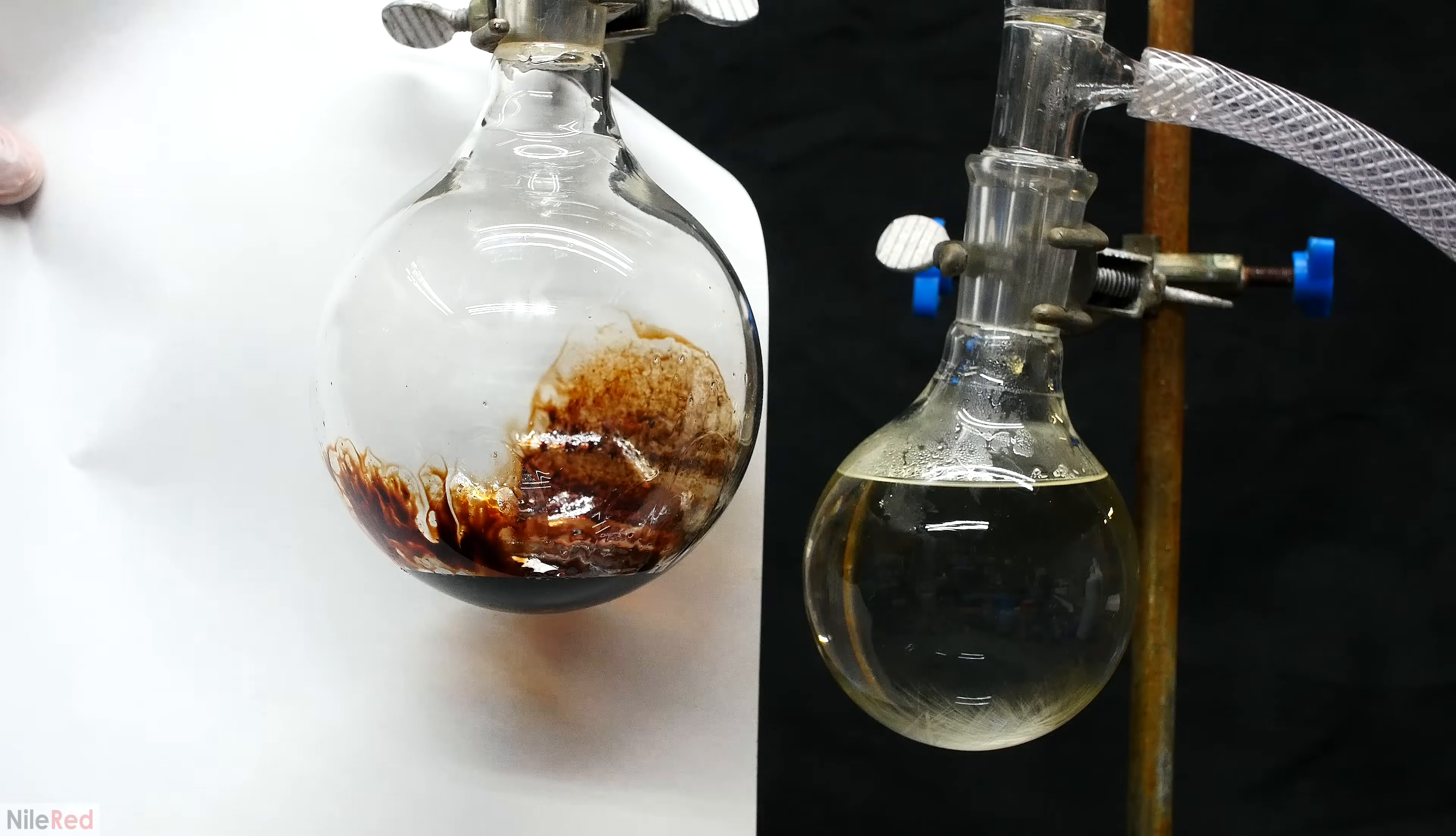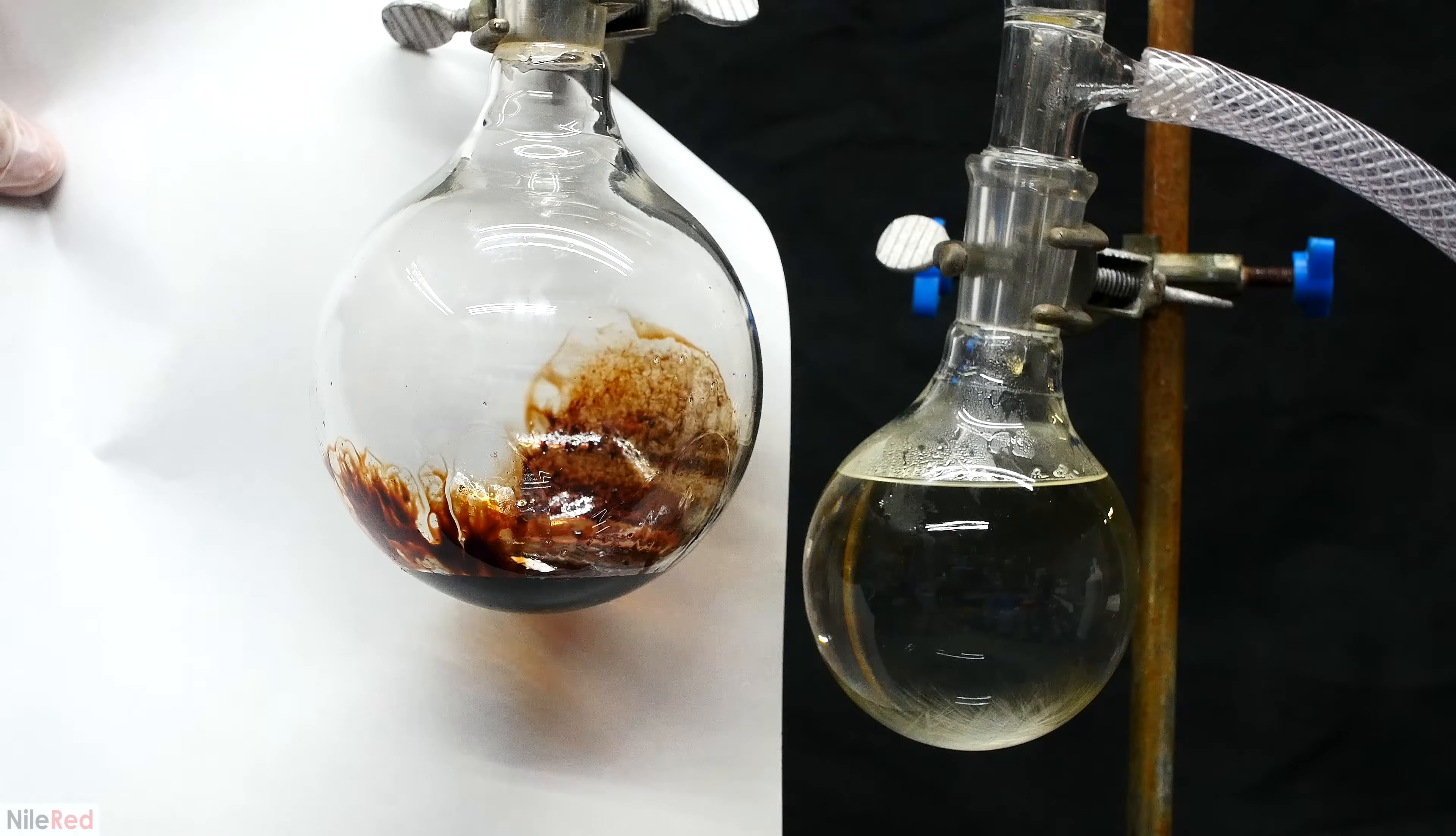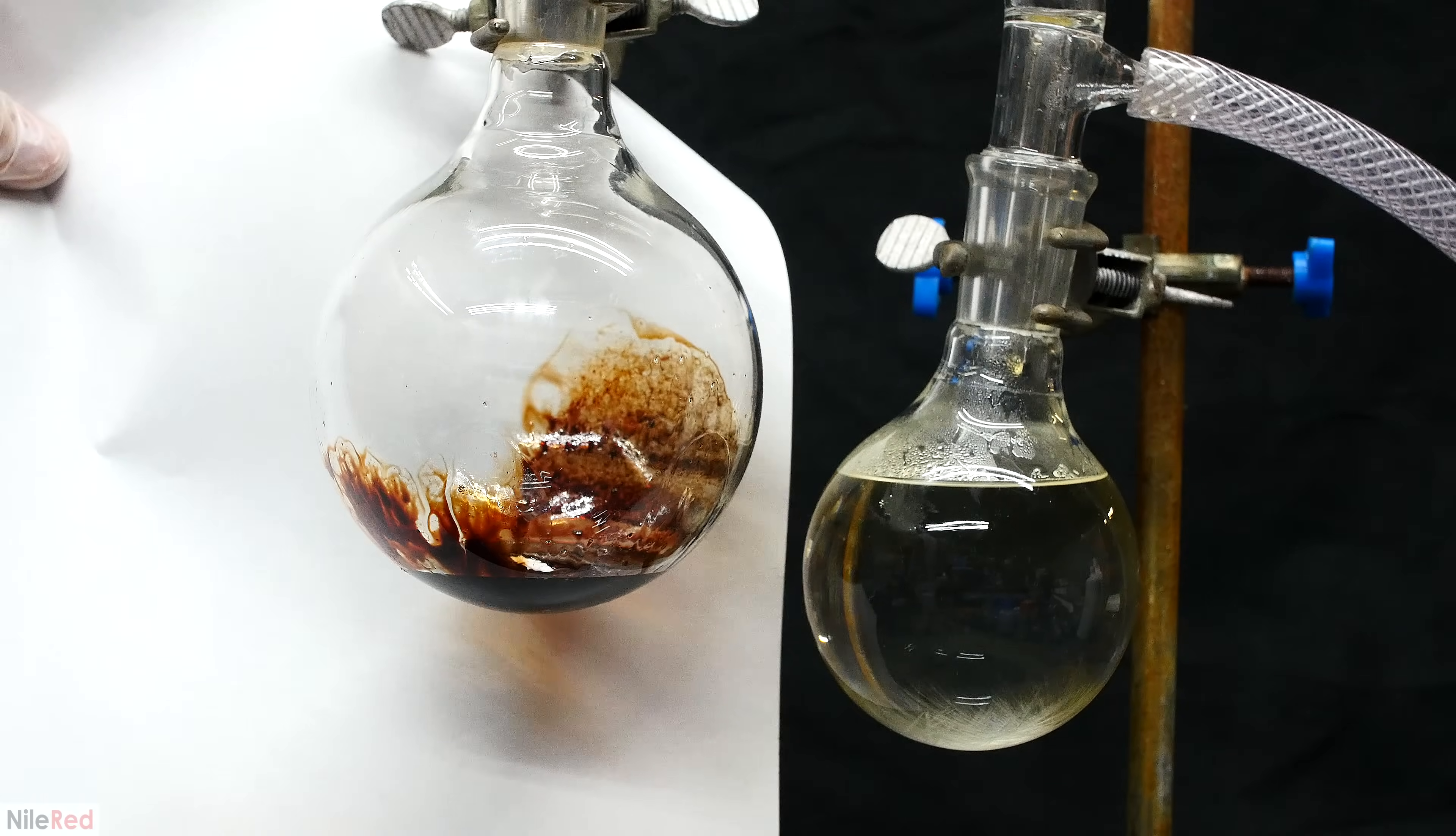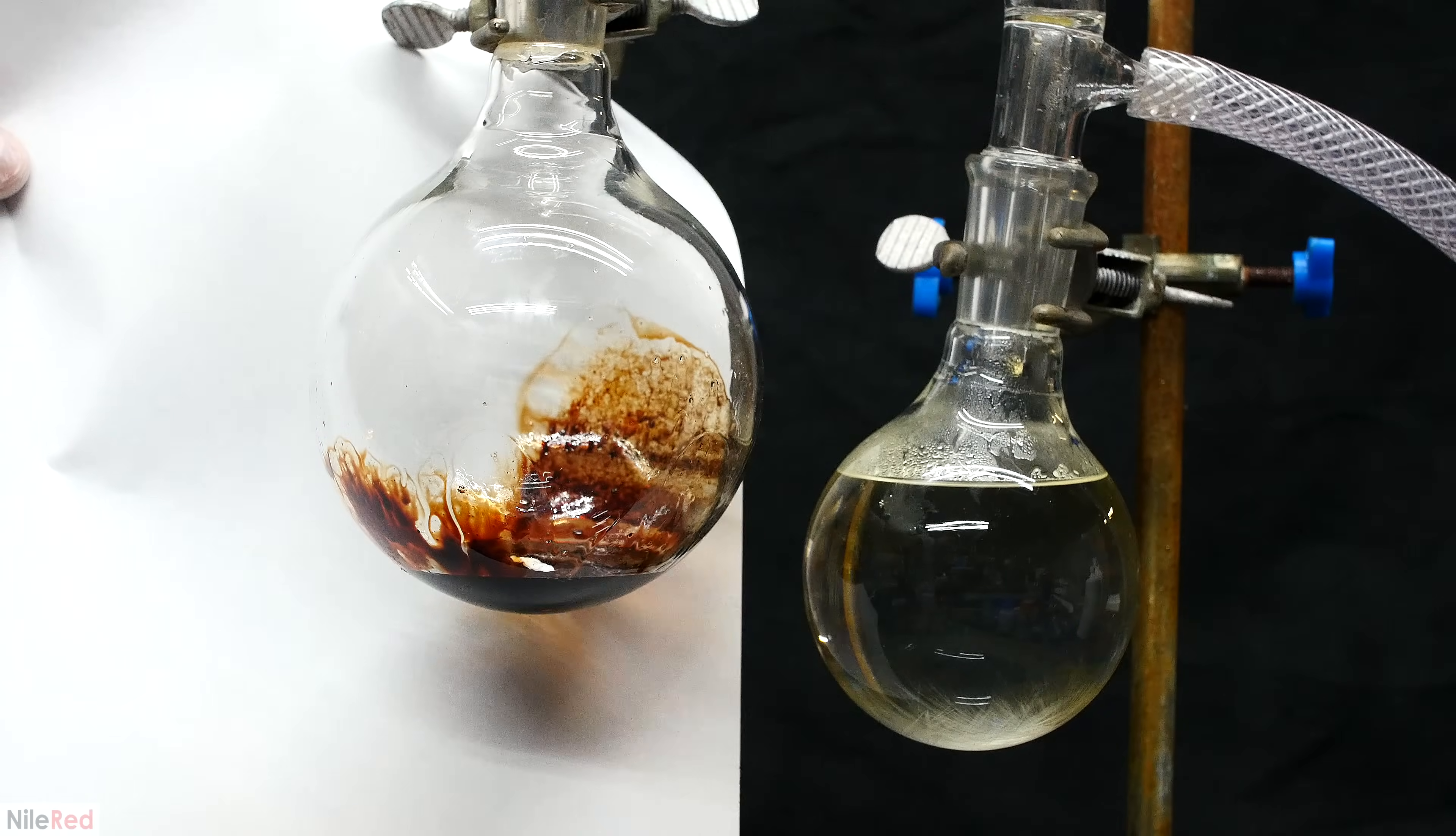I stopped the distillation immediately, and in the distilling flask, you can see we're left with some reddish brown or black goo, and unfortunately our receiving flask is tainted a little bit yellow.